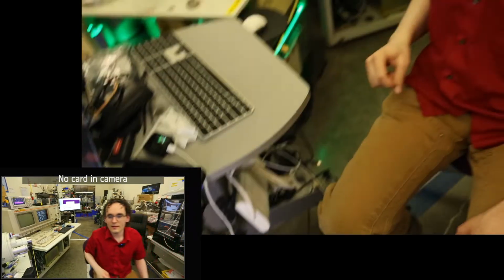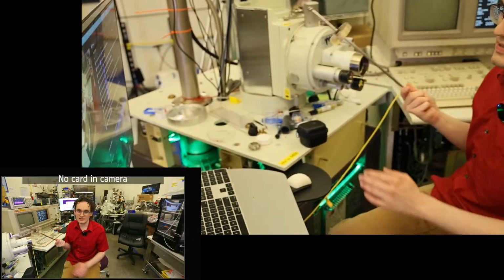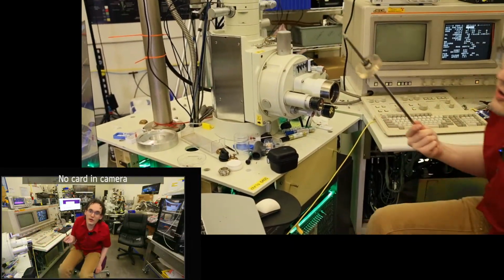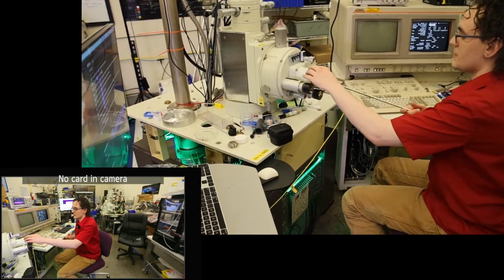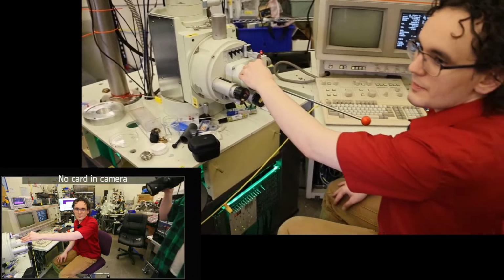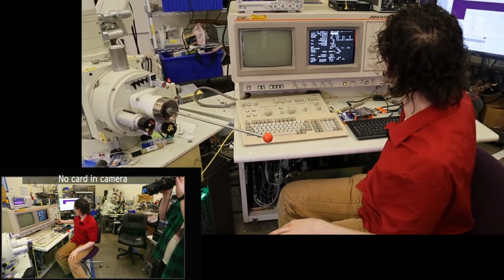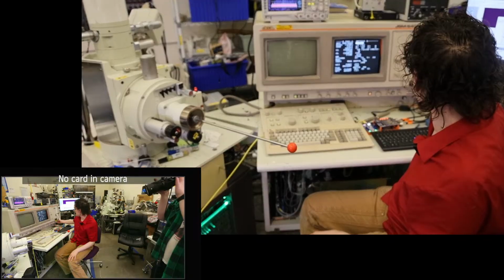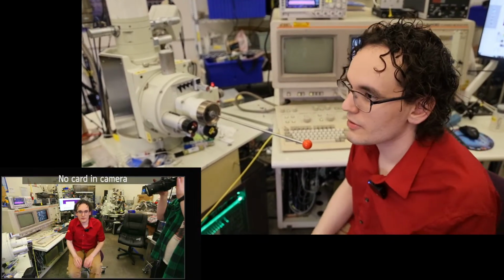Okay. Cool. So let's go ahead and do our sample exchange, because this is a JEOL 6400, and they all come with a load lock, and it's amazing. So we'll go ahead and put our sample exchange rod in. We'll hit our red button. We're going to pump our load lock down, and we're going to go ahead and turn our beam off. So now we're just waiting on our load lock to pump.